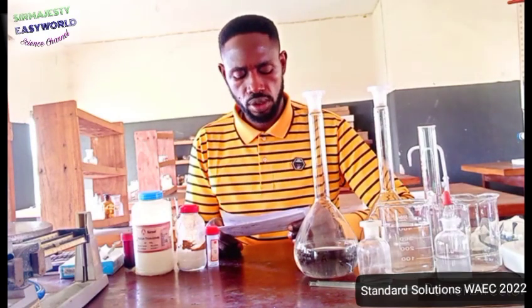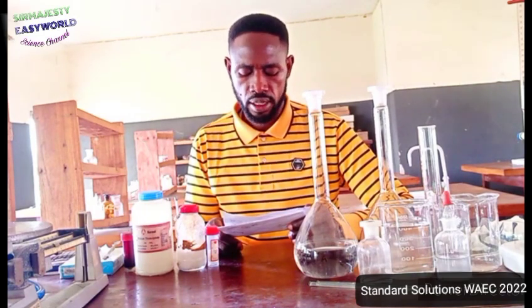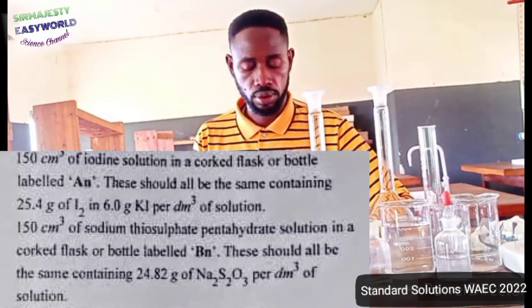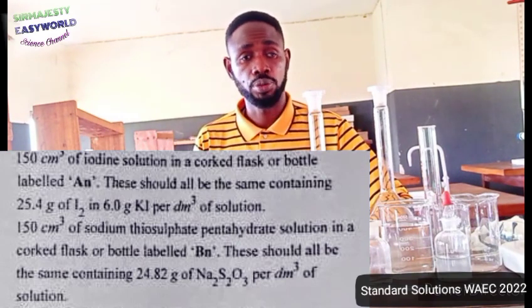150 cm cube of iodine solution in a corked flask or bottle labeled AN. These should all be the same, containing 25.4 grams of iodine molecule and 6.0 grams of potassium iodide per dm cube of solution.